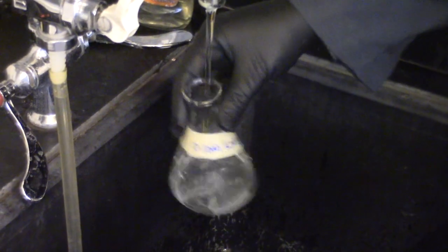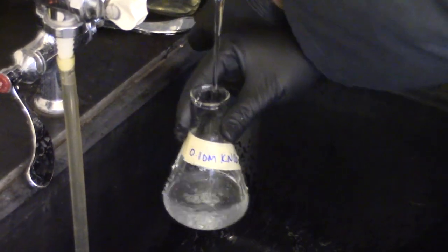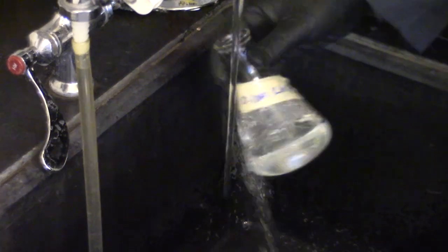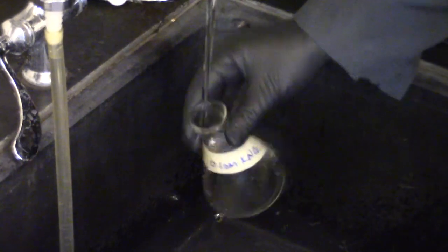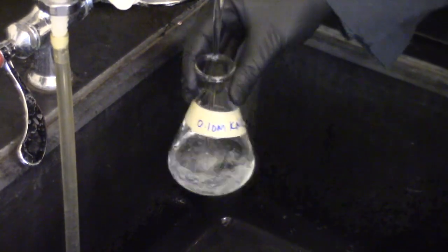While solutions are filtering, rinse out the empty flasks to use for the titrations. Potassium tartrate, potassium nitrate, and sodium nitrate are all safe to go down the sink.